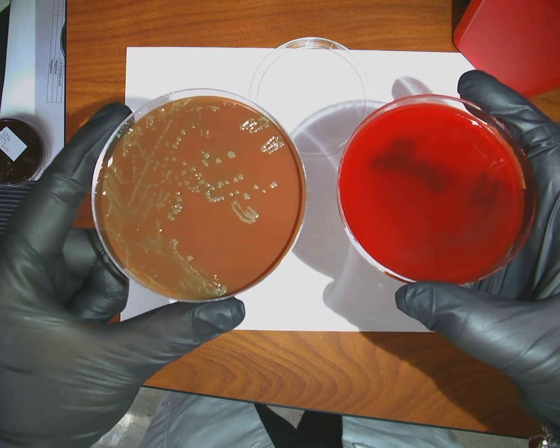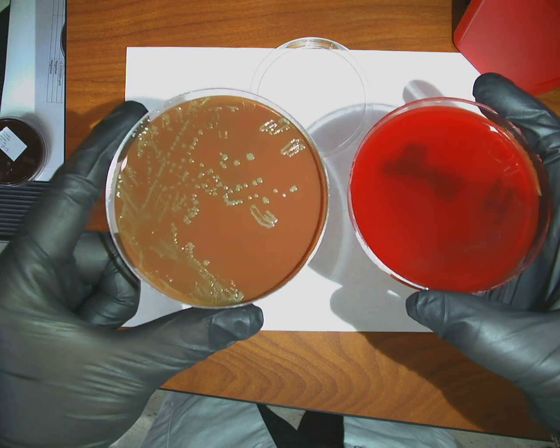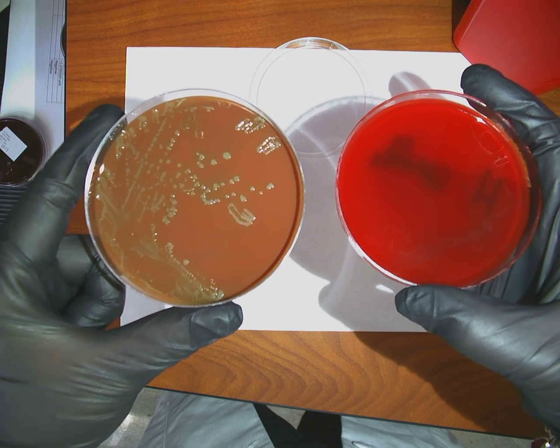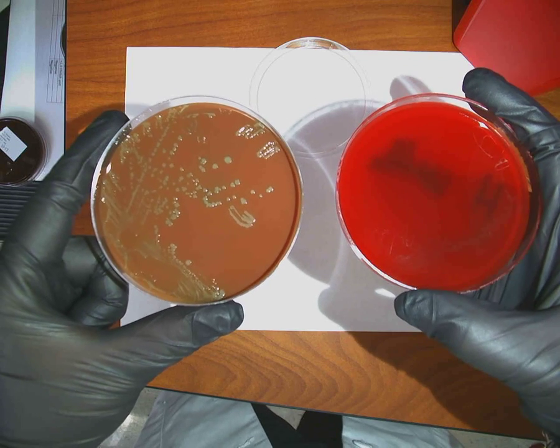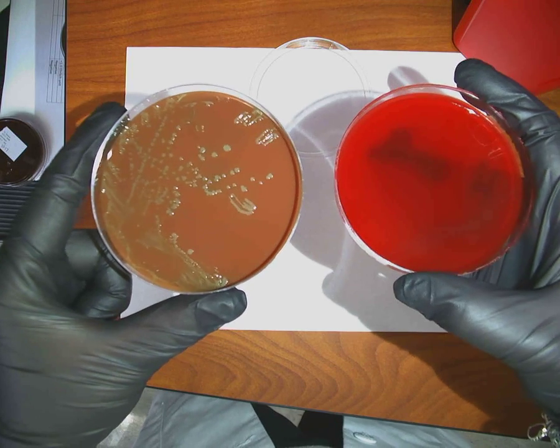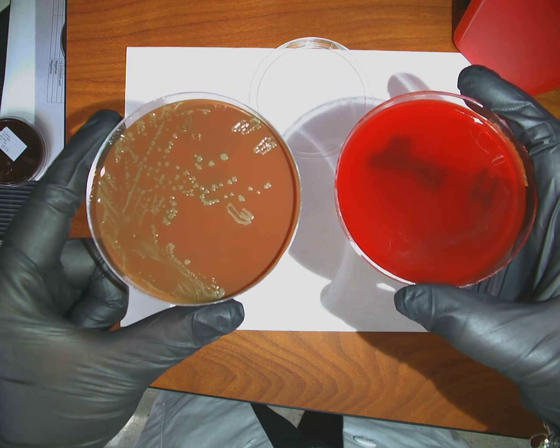And what else do you know that it's not? It's not Neisseria. That green color, Neisseria is more of a tan. Plus, Neisseria is going to be growing here. Okay, so it's not Moraxella either. They're basically in the same family. So what do you have here? You have Haemophilus, and your key to knowing that is that you have no growth on this blood agar plate at all, period. Haemophilus will not grow on blood agar because it needs what?